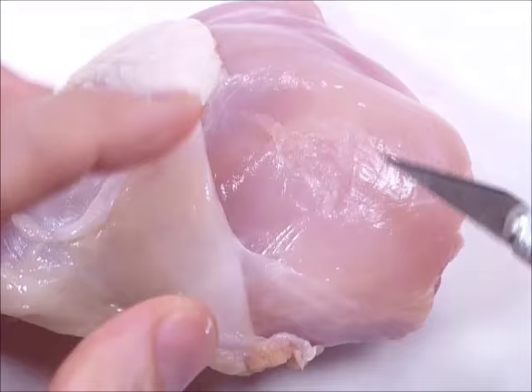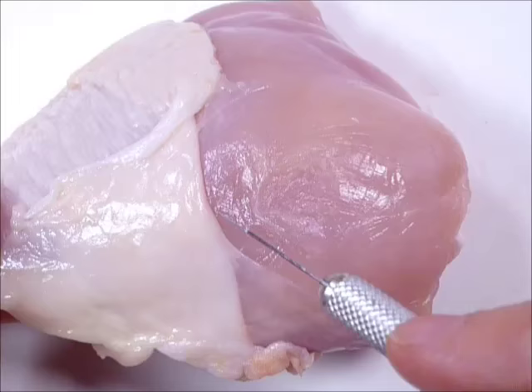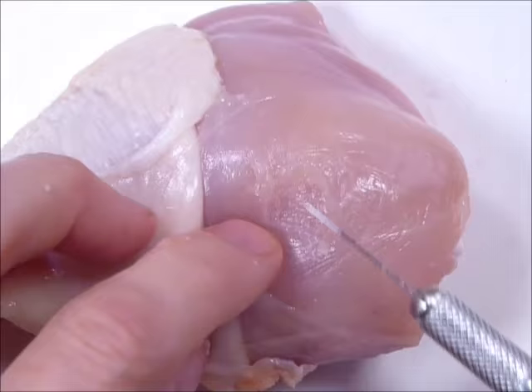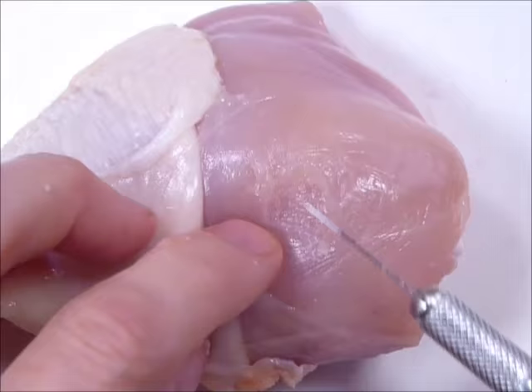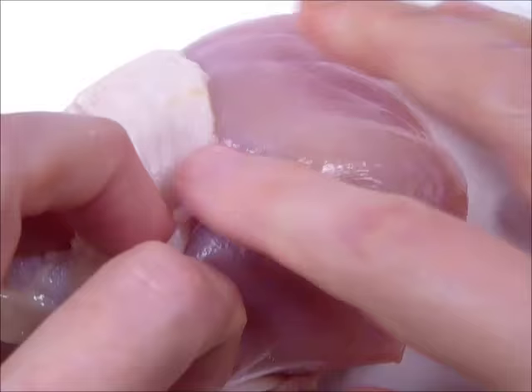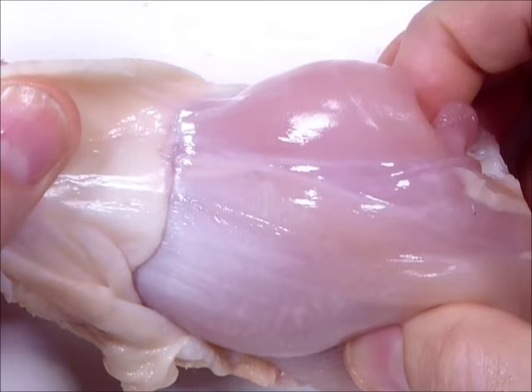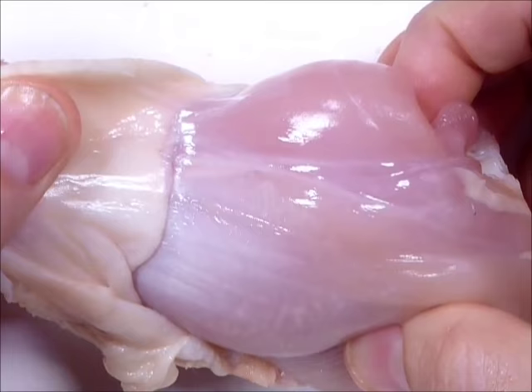There's some actual muscle tissue. It looks shiny in the film because the light is picking up the watery shine — it's just moist, reflecting the lights. But when I'm looking at it live, once you get the fascia pulled away the muscle will look more dull. Let's try that on another place down here too. Keep pulling and noticing where that bag goes — it should go all the way around.